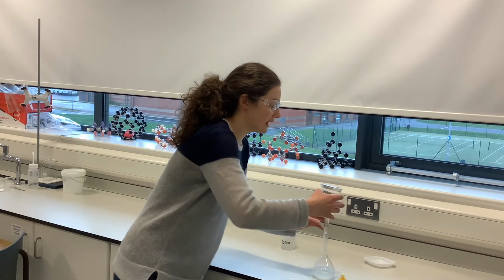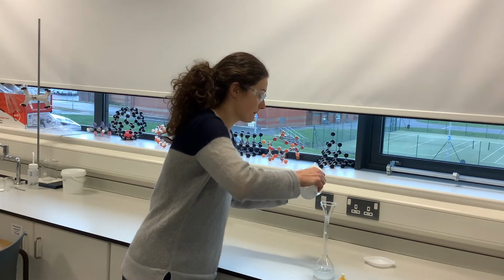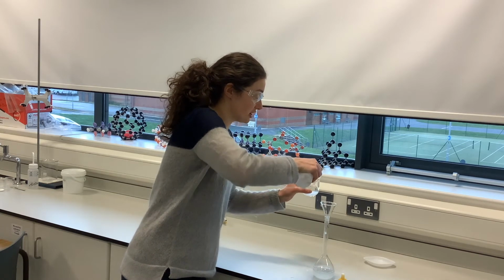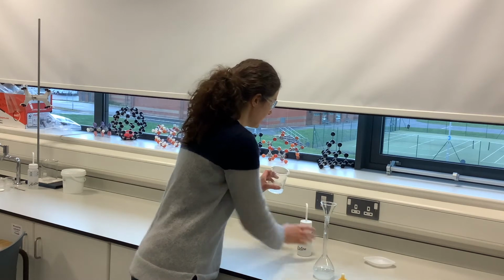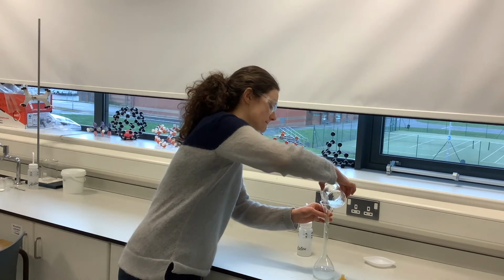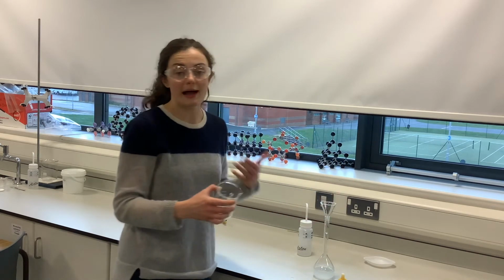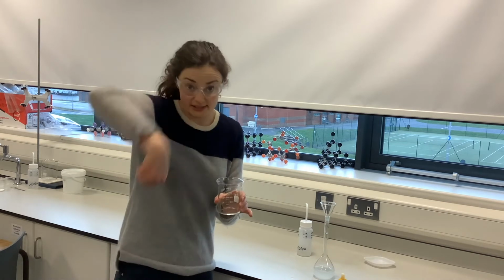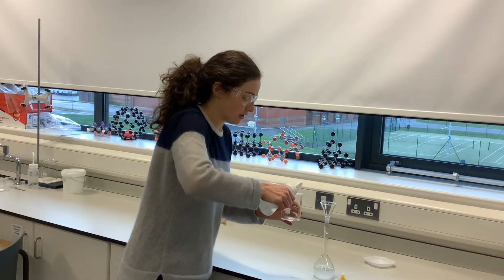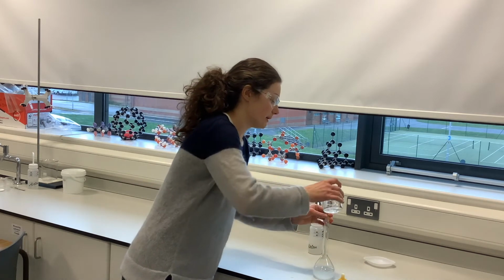Okay, what I then want to do is rinse the inside of my beaker with deionized water, just in case there's any of my solution which contains any of my salt in the rest of the beaker. Swirl it round a little bit and add that to the volumetric flask. That's what we call adding it with washing. So in other words, that is washing the inside of the beaker. And we can do that again just to make sure, just in case any of it is still around the edges of the beaker.